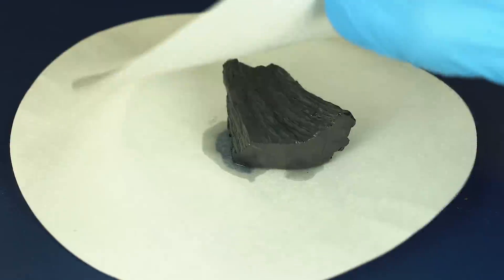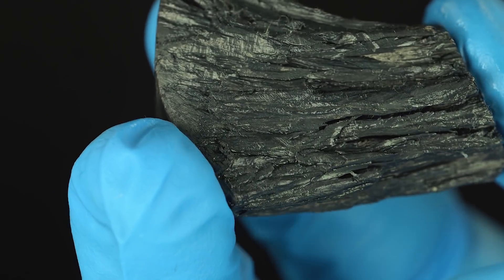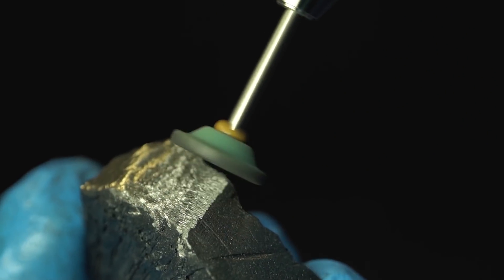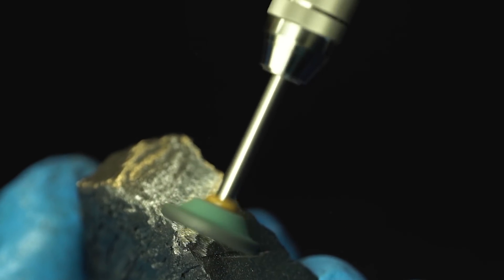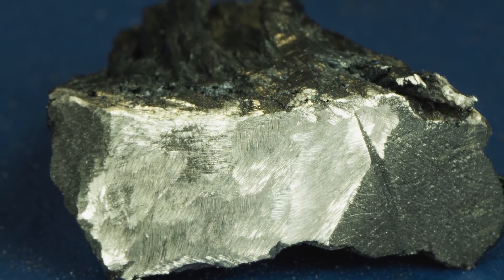As you might notice, my sample of metallic samarium doesn't look like a cast ingot. It's a chemical element obtained by dendritic crystallization, that got its name for its resemblance to a tree's body with branches going away from it. In air, samarium gets covered with a layer of oxide, so I had to uncover the metal surface to show you the genuine element. That's what a purest sample of metallic samarium looks like.